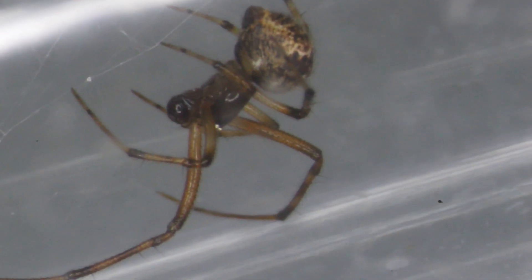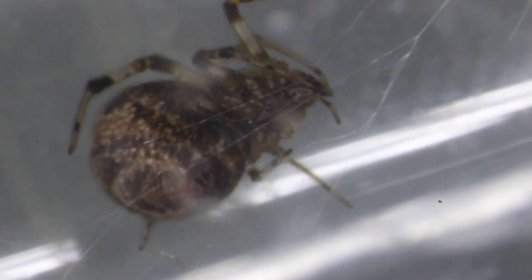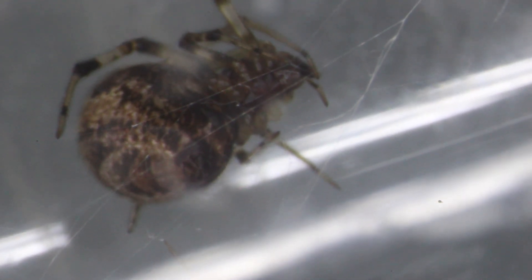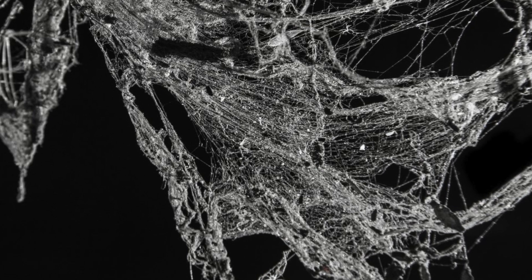Flat-sided vials are kind of necessary here. I guess they're done now — time to take a nap. Oh look at him pumping his pedipalps there. H8 is a very handsome little spider. He has to recharge his pedipalps before he can go at it again. And there's Vera looking handsome too. Okay, these go back into the incubator and I will check them tomorrow. Let's see if they start producing an egg sac — that would be very nice.